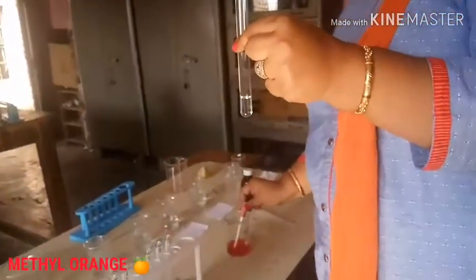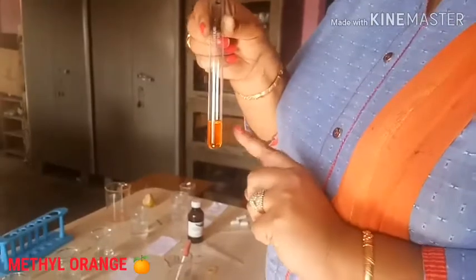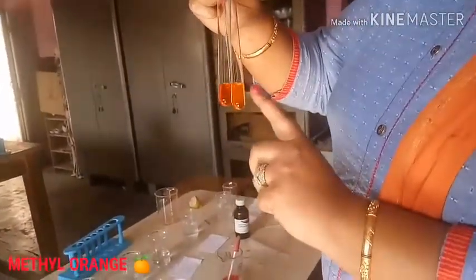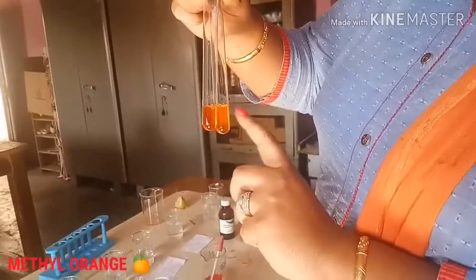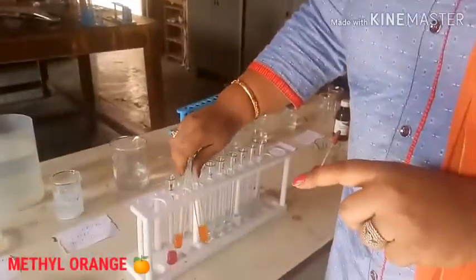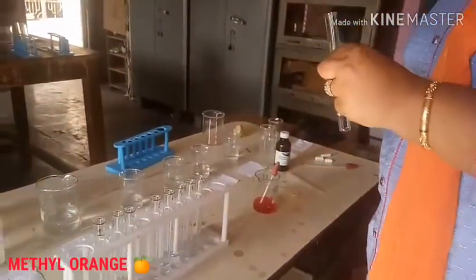Our third sample is sodium bicarbonate — slightly basic. It is also of yellow color. Carbonate is a strong base and bicarbonate is less basic. So you can see the intensity of color: in carbonate, yellow is darker, and in bicarbonate it is a little bit lighter. The intensity of color also depends upon the strength of the base.